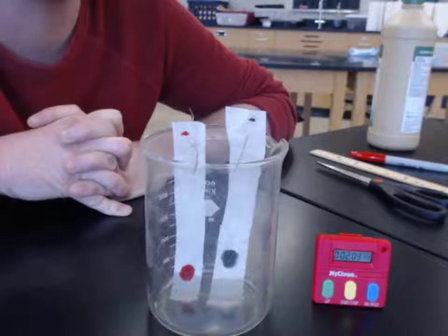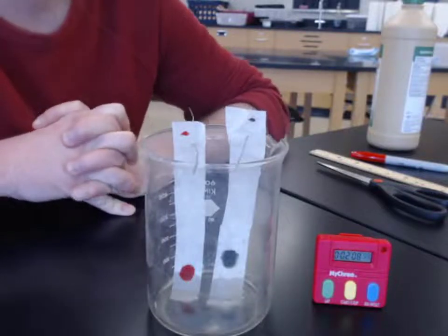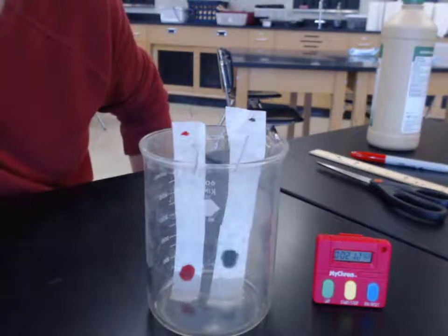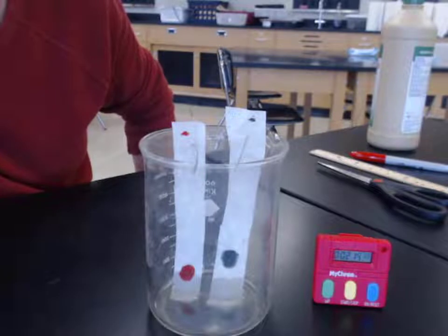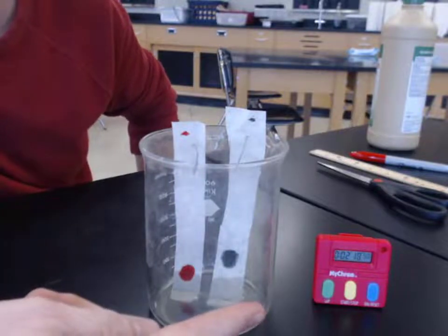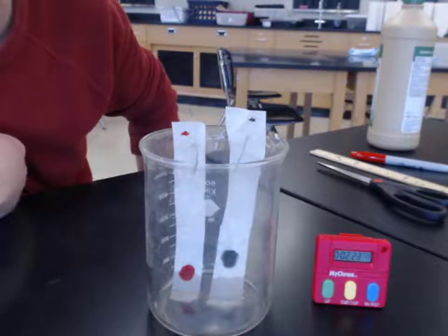So I would wait until maybe that isopropyl alcohol passes through our first blob of ink, the red one. Maybe we'll see something different. We could do an observation then. But we'll just continue to let the clock run so we know what timestamps to put down for our observations.